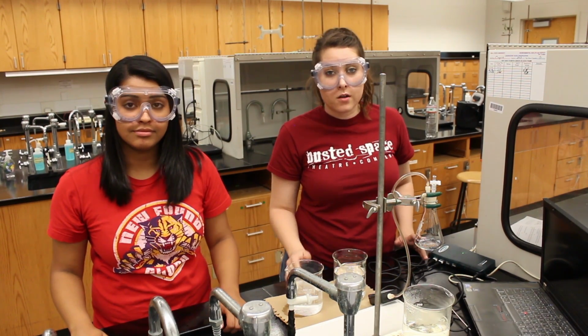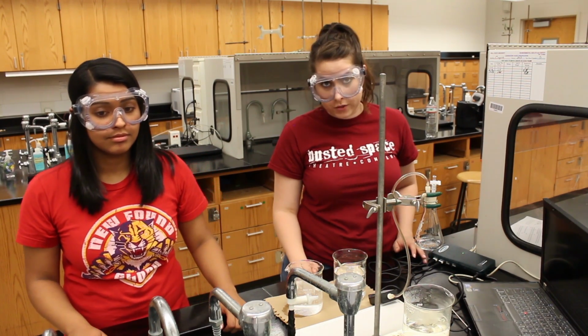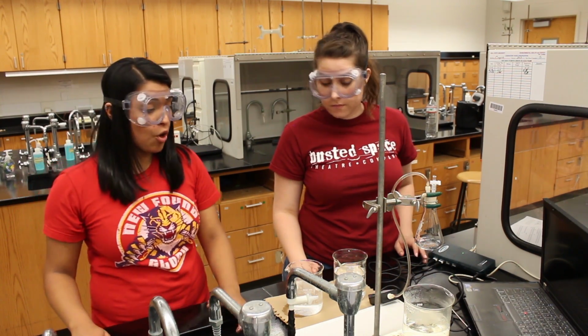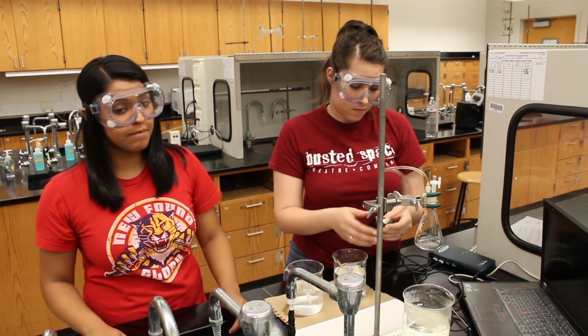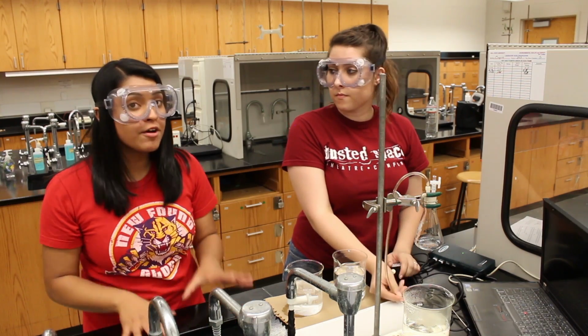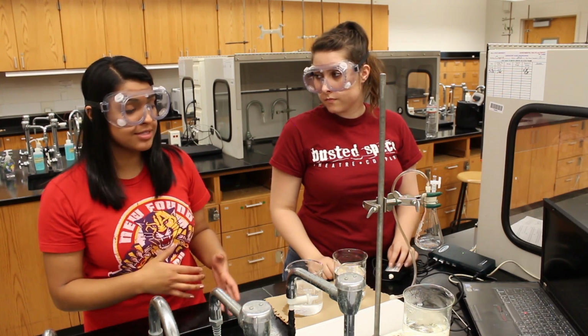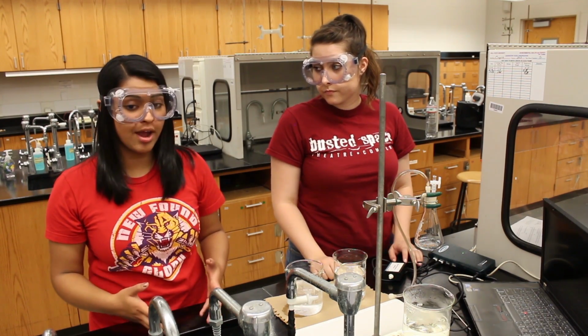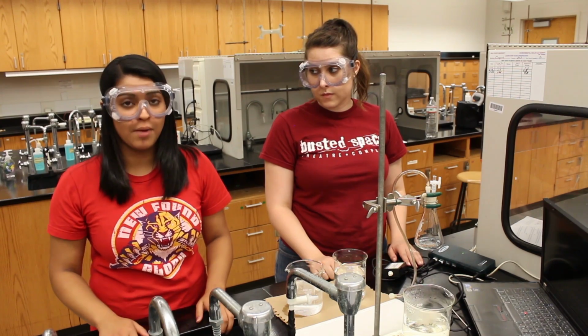Then you'll want to save all your data to the desktop and print off copies for both you and your lab partner. Now you can open the gas valve. Disconnect the pressure sensor from the tubing and the rubber stopper very carefully and return everything to the gas pressure sensor box, making sure that the equipment is dry. Then return all the computer hardware into the Vernier Lab Pro box.